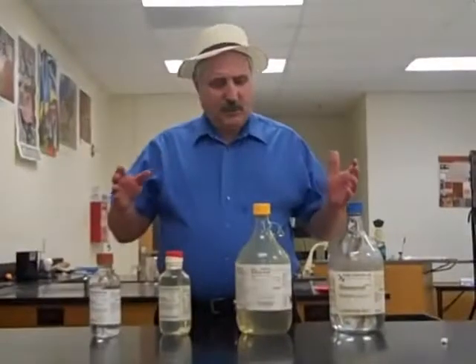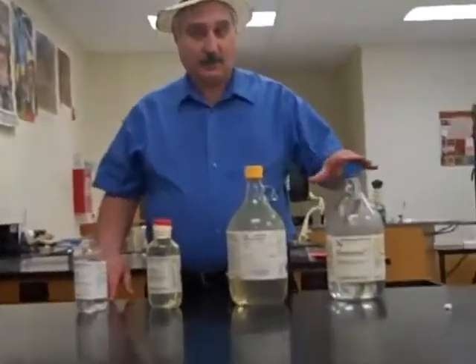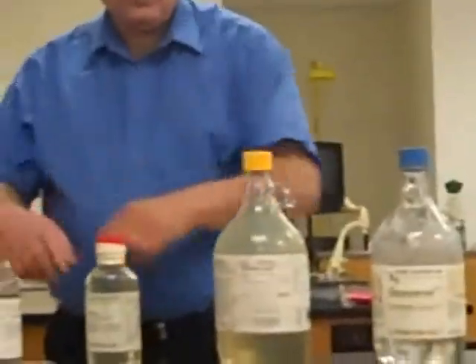Hello. Today we've got 4 acids in some glass bottles. This is hydrochloric, sulfuric, nitric, and acetic acid.